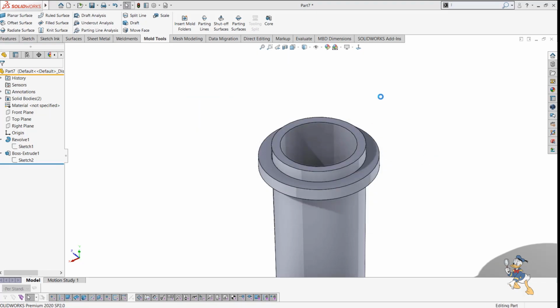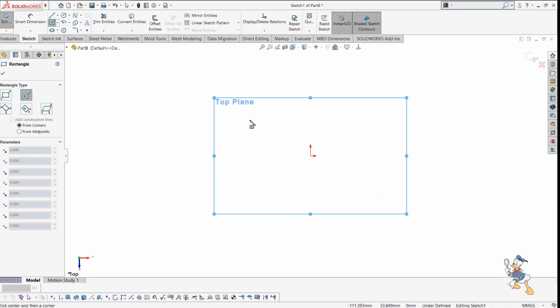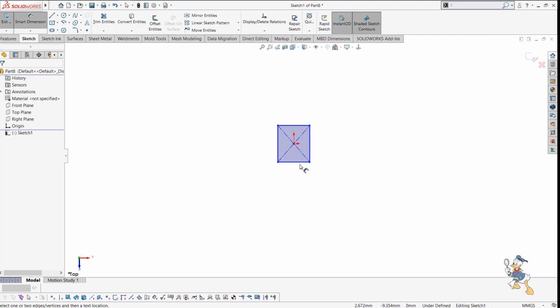So this is how we can design a plastic component in SolidWorks. This is a very simple component, and I'll just show you the important features of mold design or plastic component design, where you need to check the draft value and whether there are some sort of undercuts or not. Then I just need to generate the sketch of this and provide dimensions to it.